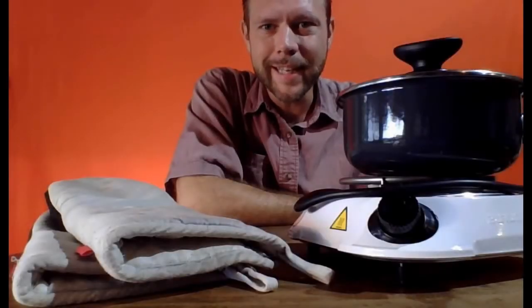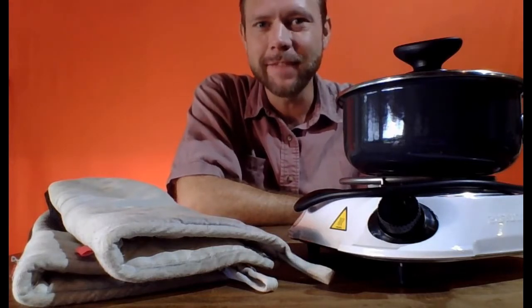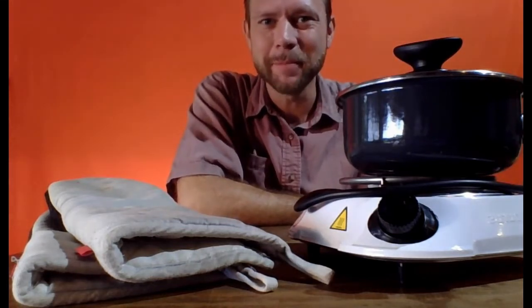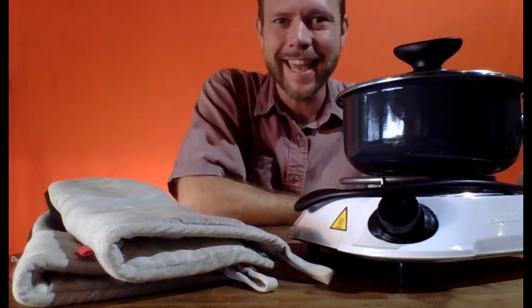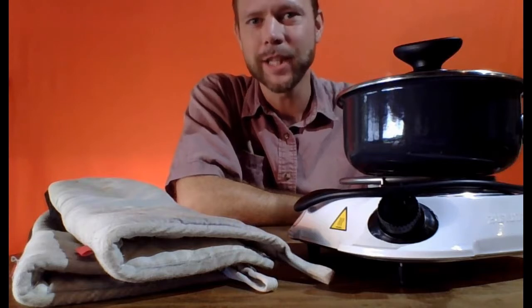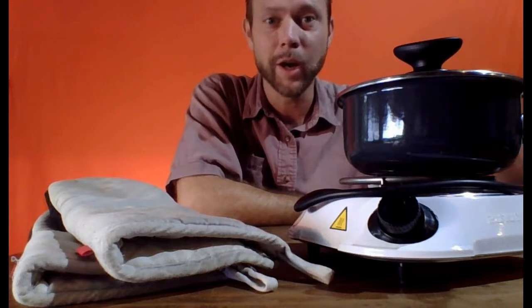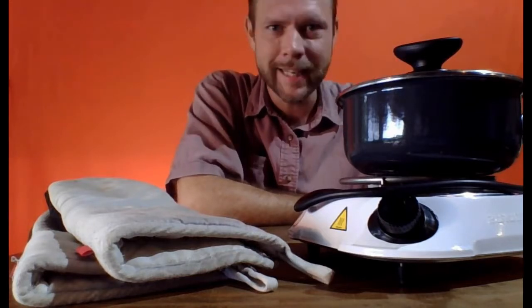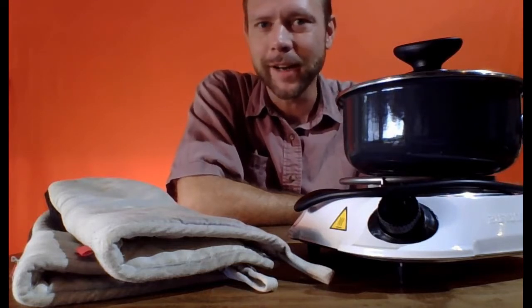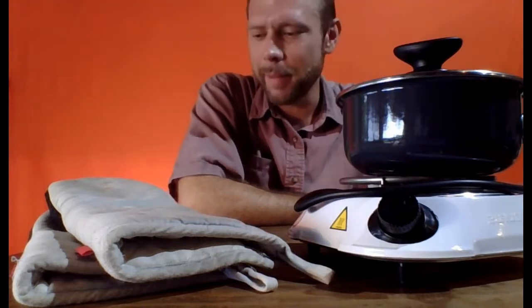Okay, so before we get started with the experiment, we do need to have a safety discussion. Obviously, extremely important, perhaps the most important thing, that we stay safe while we are doing chemistry. So first of all, if you're just going to watch, that's fine. Go ahead and watch. You don't have to repeat the experiment at home. Maybe you're interested in repeating the experiment at home, so you definitely want to be aware and follow this safety advice as you set this up and do it.